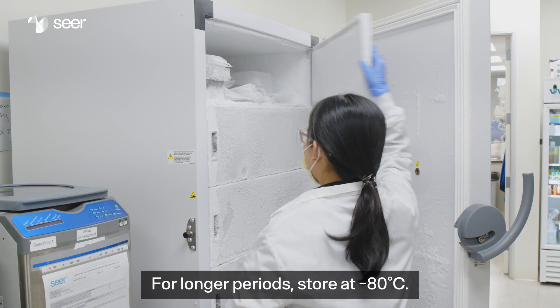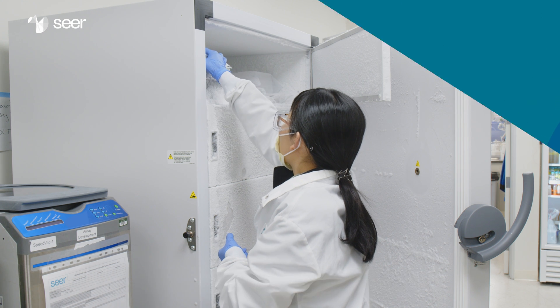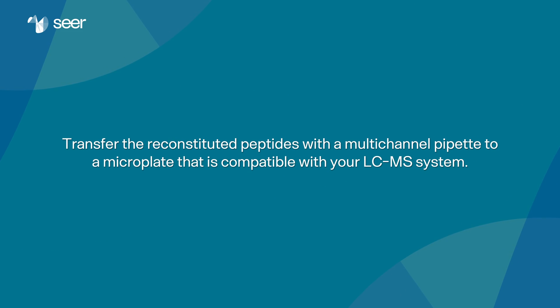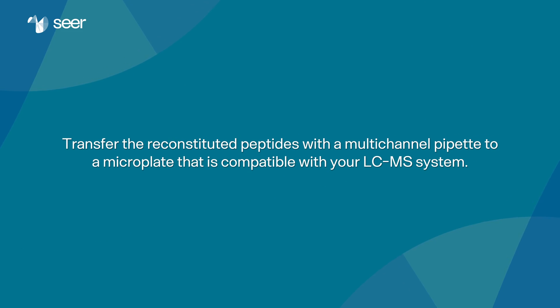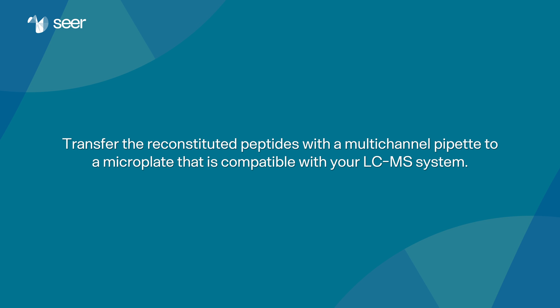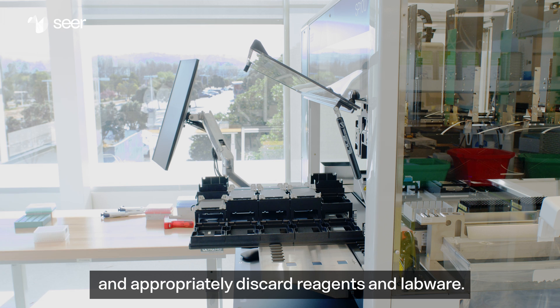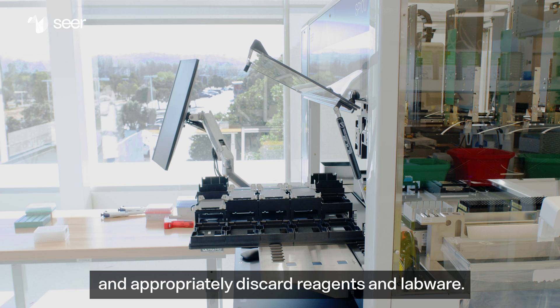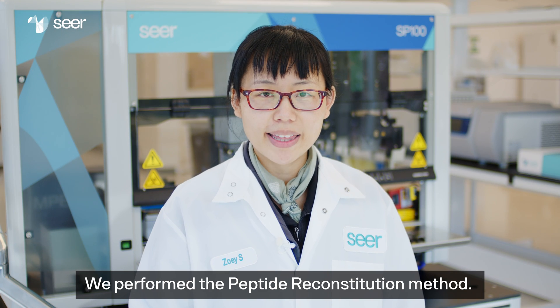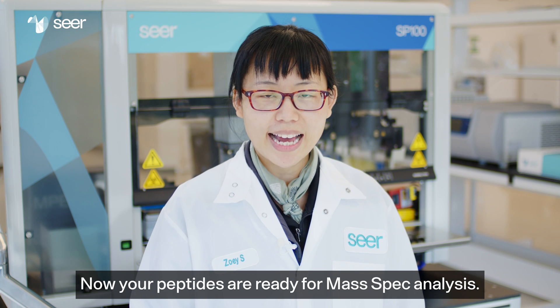For longer periods, store at minus 80 degrees Celsius. Transfer the reconstituted peptides with a multi-channel pipette to a microplate that is compatible with your LC-MS system. Clean the work deck and appropriately discard reagents and labware. We performed the peptide reconstitution method. Now your peptides are ready for mass spec analysis.